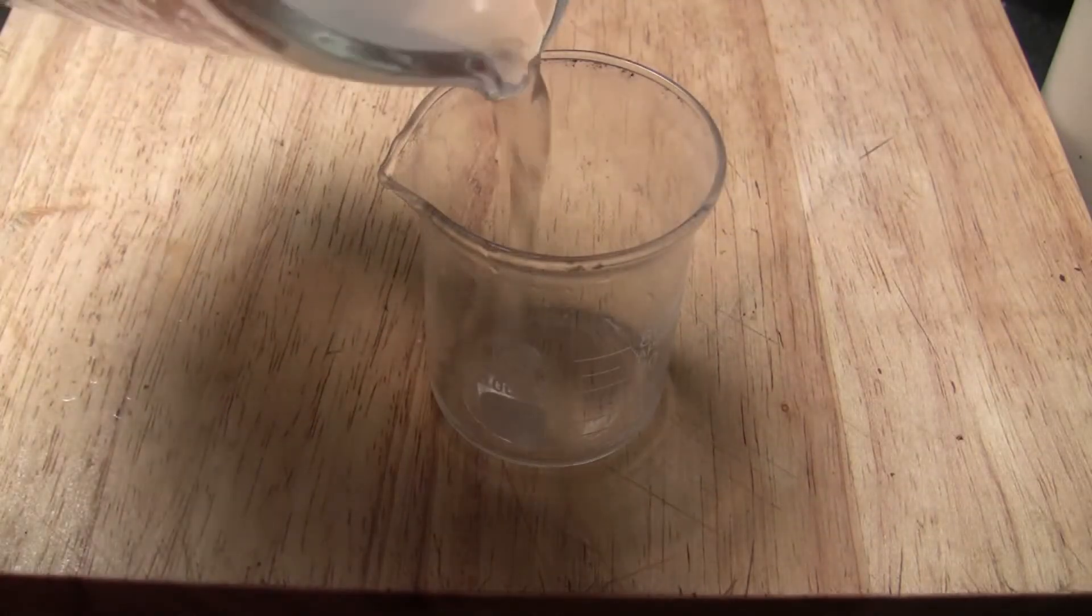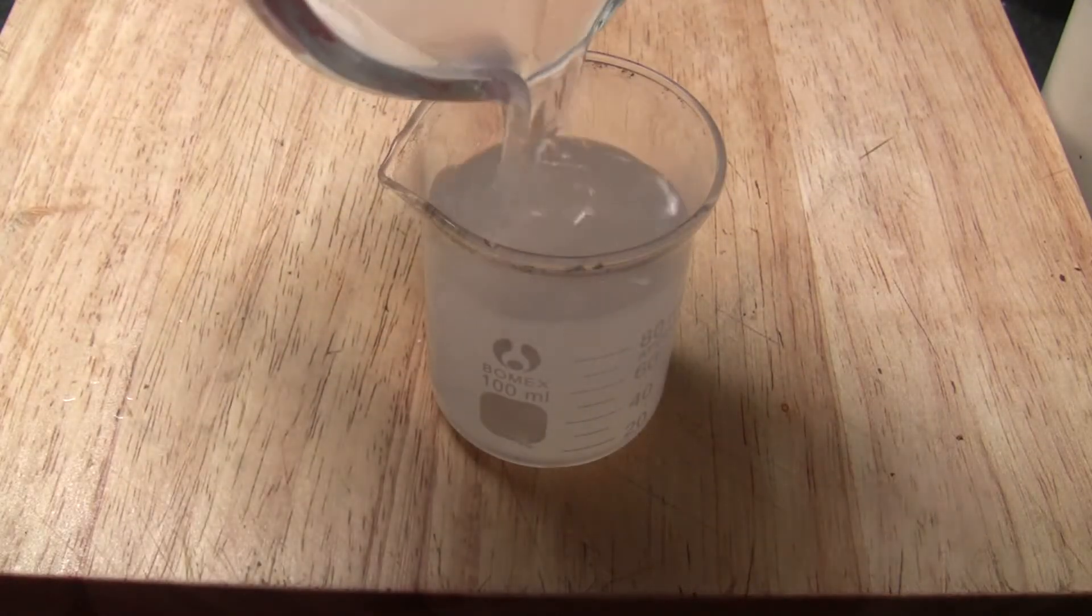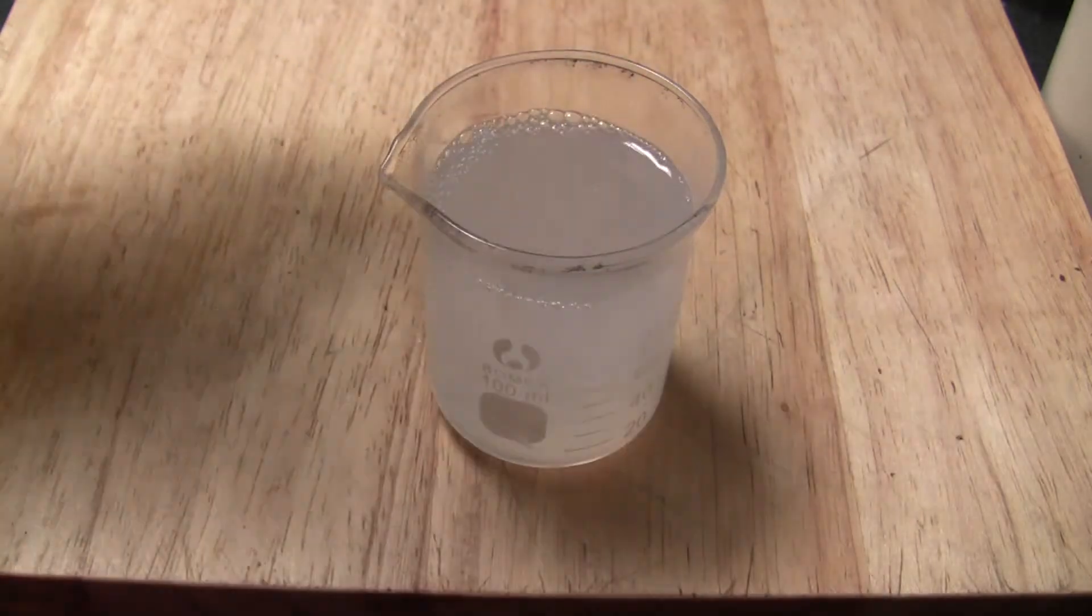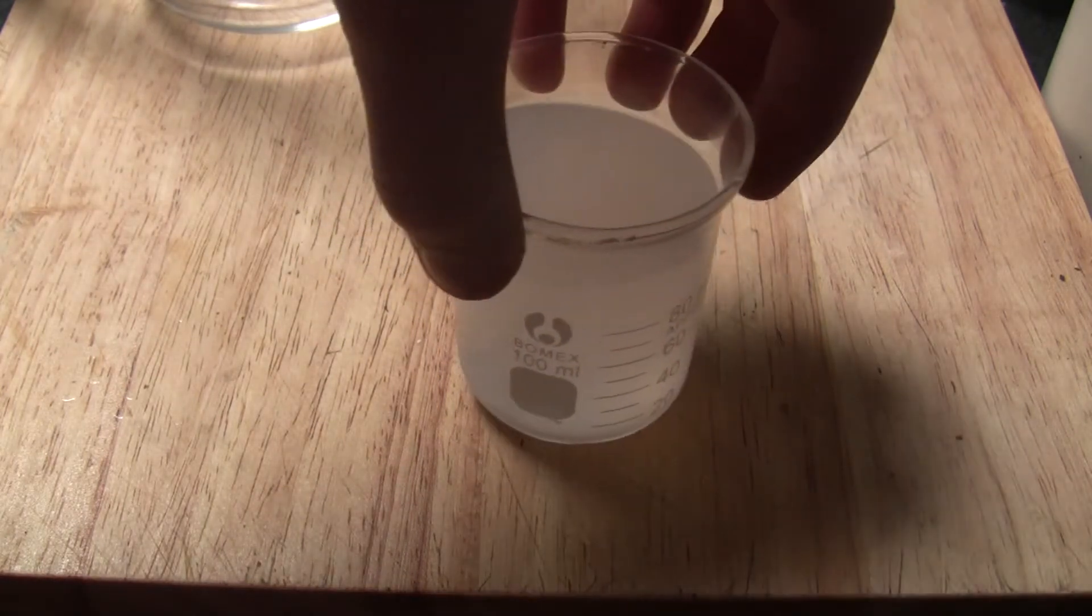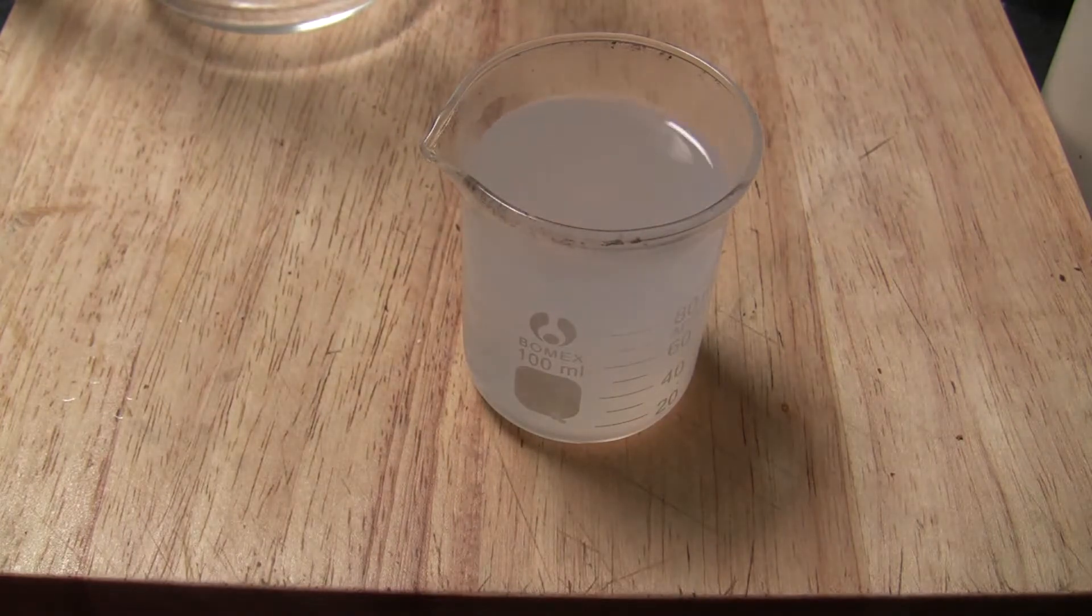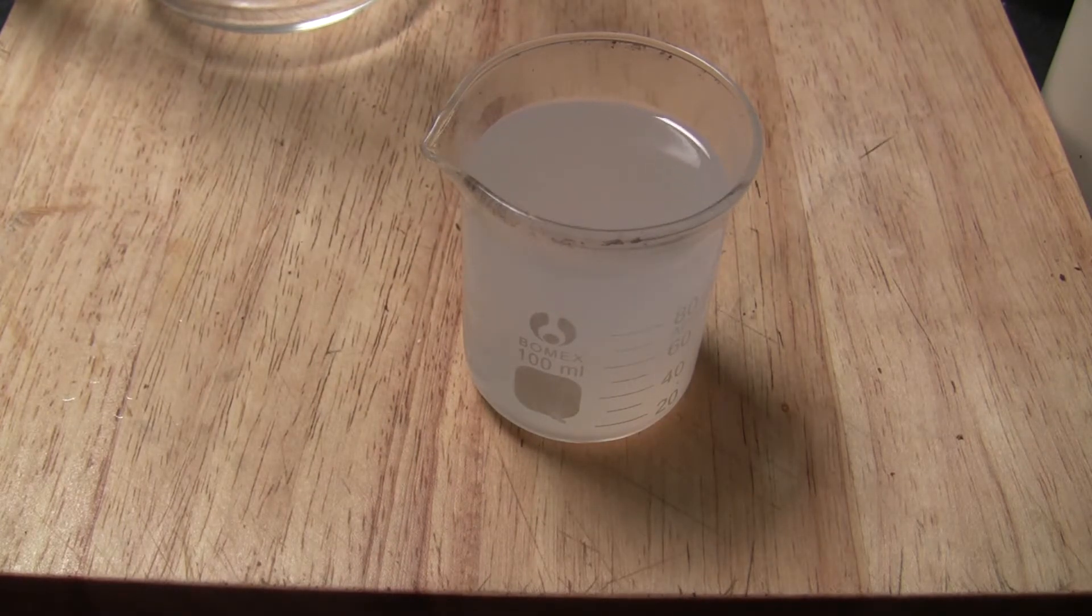Dissolve as much as possible into 100ml of water. It may take some time of mixing to get it all dissolved. Mine's a bit murky because some bits haven't dissolved, but I'm sure it won't matter. You can just recrystallise the remaining salt once it has crystallised out to get a high purity.